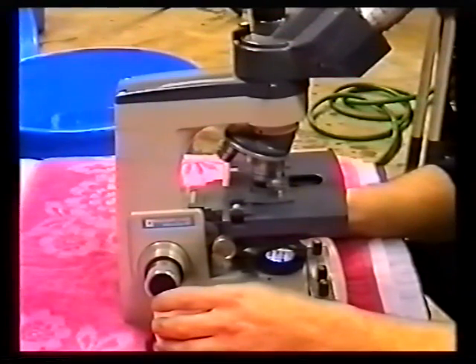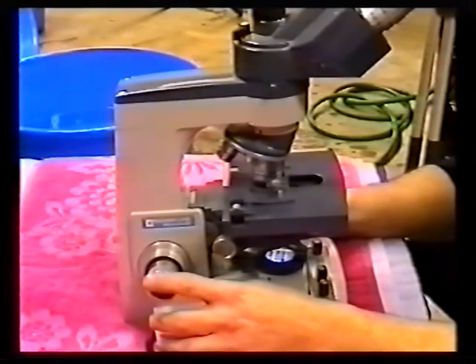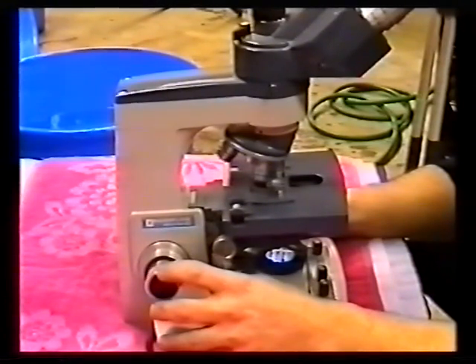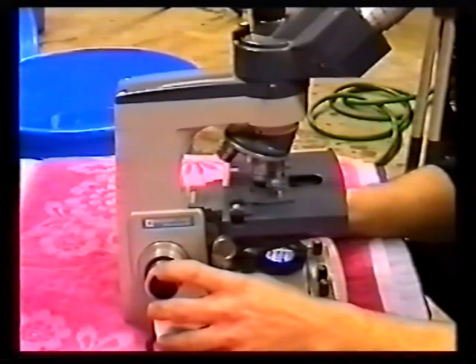Gently apply pressure to the slip with your finger to slightly compress the sample and place your slide under the microscope. As we said earlier, it is always advisable to completely view the periphery of your specimen first, as parasites can be seen easier in the area of clear fluid surrounding the mucus.